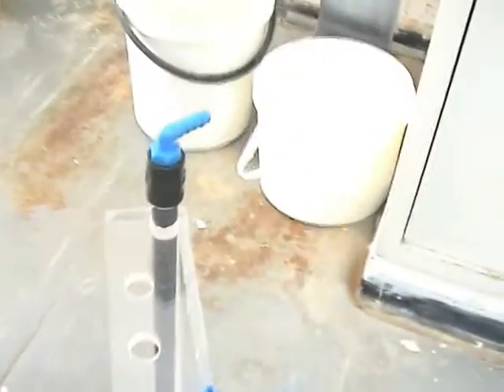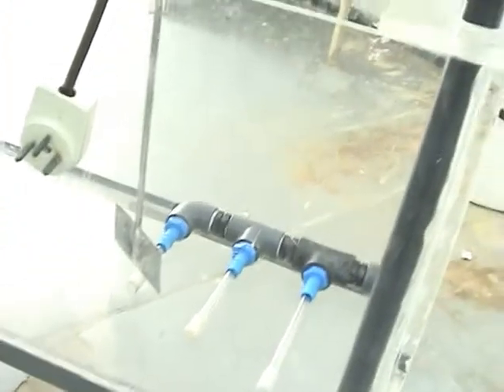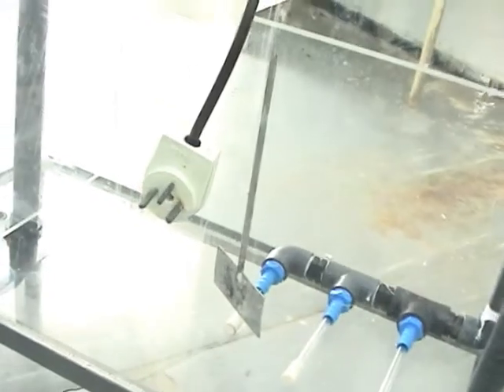Moreover, in this part of the reactor we have the mixer. This is the motor — we can control the speed and it goes to the bottom part of the reactor that mixes the reactor. Let me just take it out now so I can still show you the reactor.